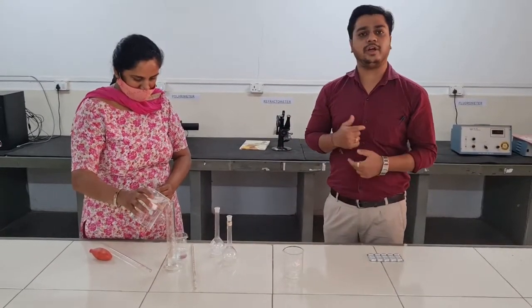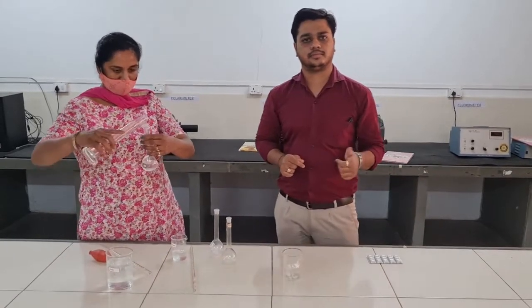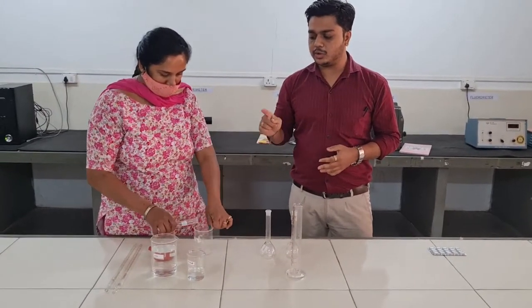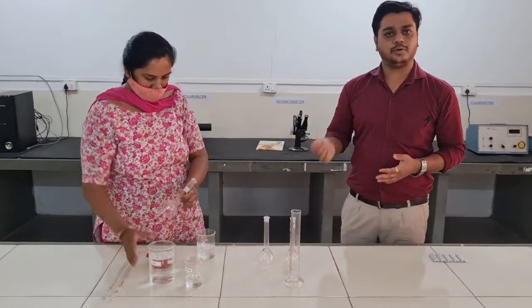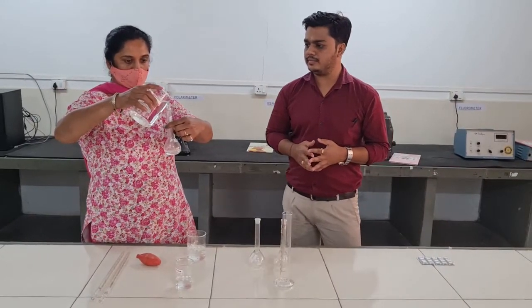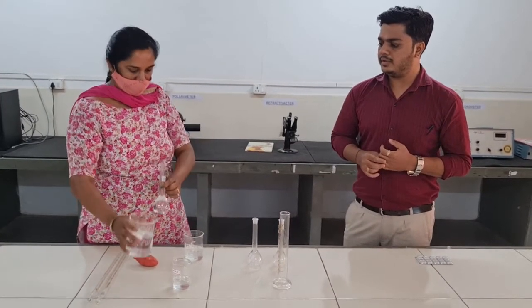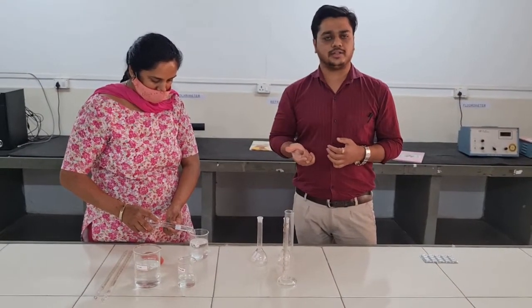Then you have to shake it for 15 minutes. After shaking for 15 minutes, now we have to make it up to 200 ml. We are transferring the total solution into the beaker and adding another 100 ml of water. After mixing we are going to filter the solution.